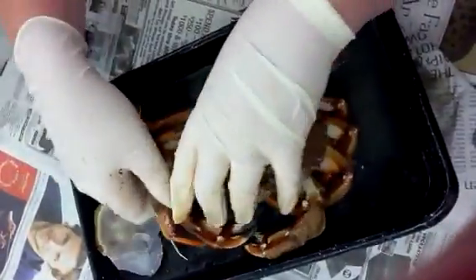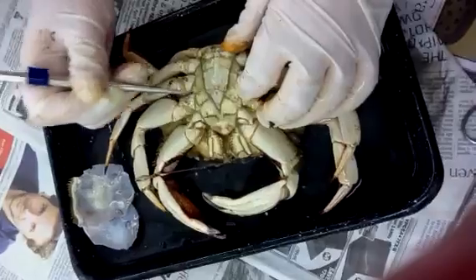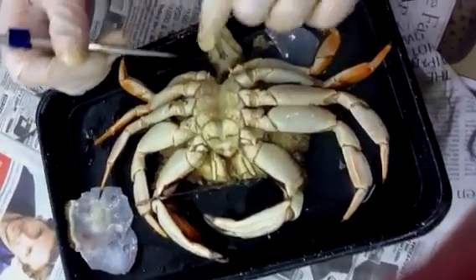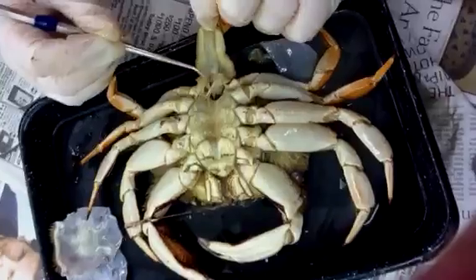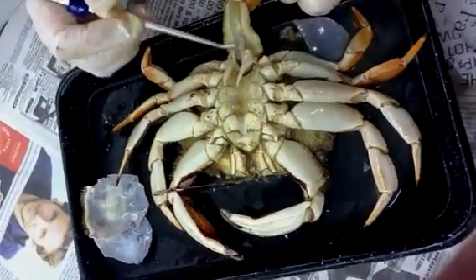And we're going to flip it over. Like a lobster, this is the end of the animal. And you can see these are the modified male appendages for pushing the spermatozoa into the female.